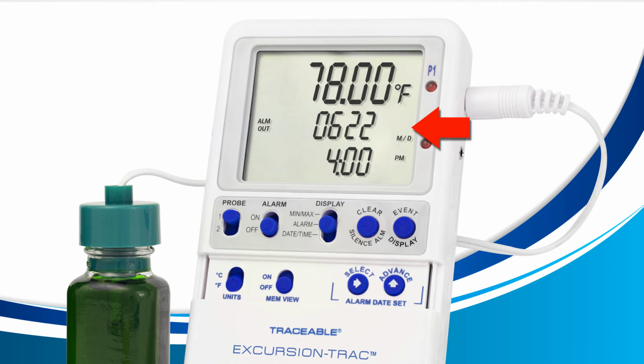The row in the middle says what day my temperature exceeded my high alarm of 78 degrees Fahrenheit. In this case, it's June 22nd. And lastly, the bottom row says what time my temperature exceeded the high alarm of 78 degrees Fahrenheit. In this case, the temperature rose above 78 degrees Fahrenheit at 4 p.m. In summary, on June 22nd at 4 p.m., the environment my thermometer was monitoring rose above 78 degrees Fahrenheit.